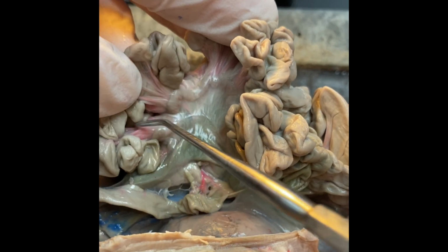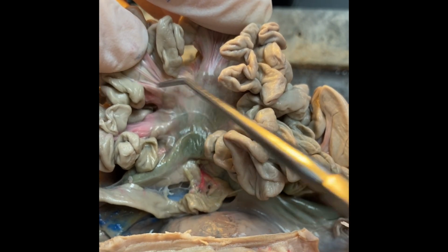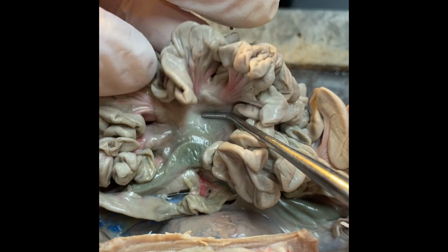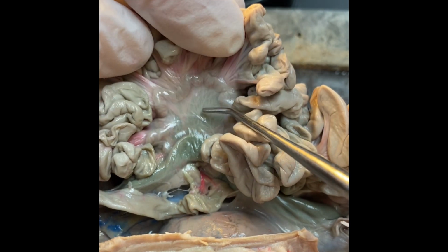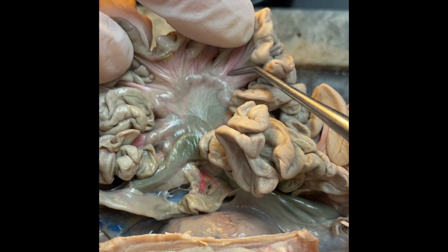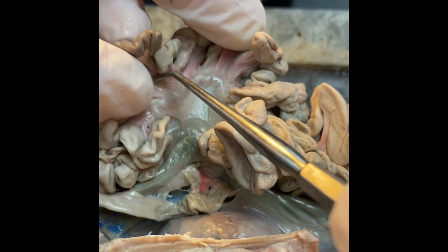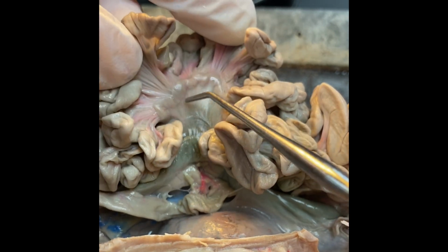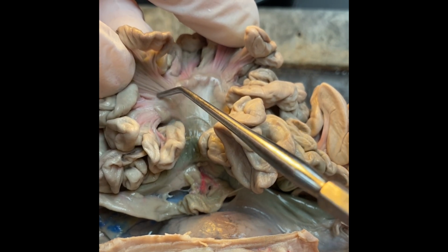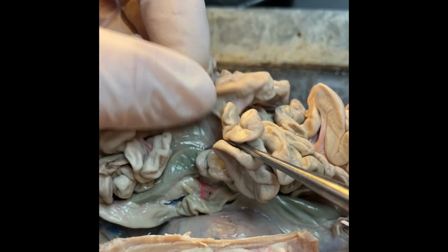This region of the small intestine that I'm holding up, all this webbing and all of the blood vessels you're seeing, is actually the mesentery. It's what holds our intestines together and in position. And all of these arteries that you can see, all the pink, there's also veins in here. These are responsible for taking the nutrients and delivering it back to our bloodstream. These are called the mesenteric arteries and veins.